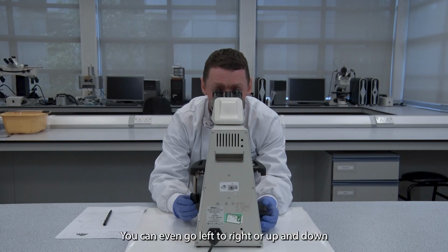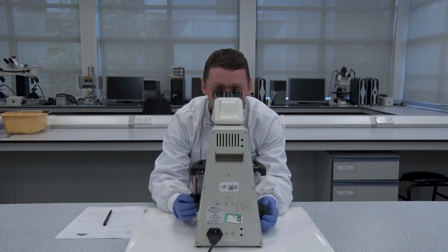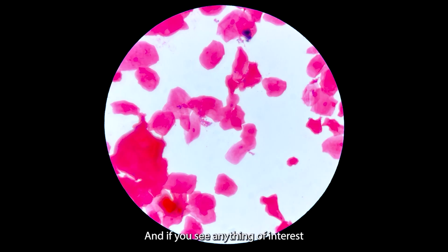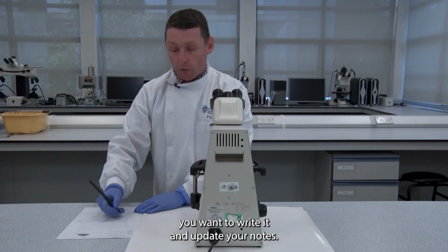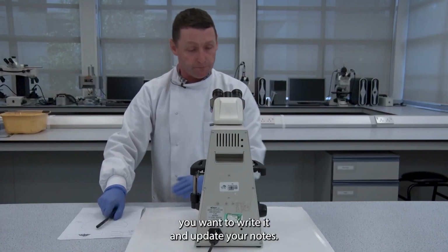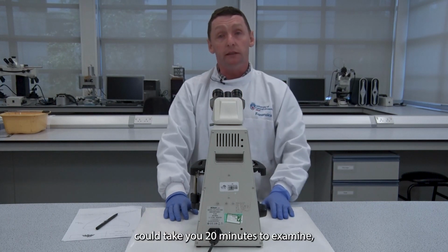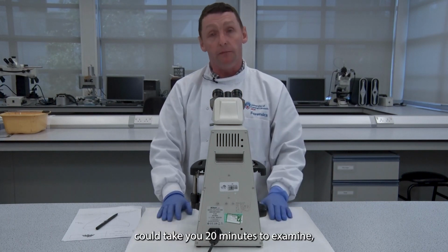You can either go left to right or up and down until the whole surface area is completed. And if you see anything of interest, you want to write it down and update your notes. A normal slide could take you 20 minutes to examine.